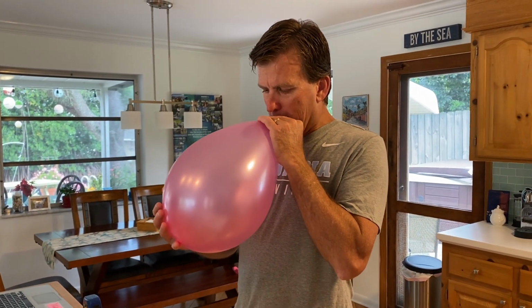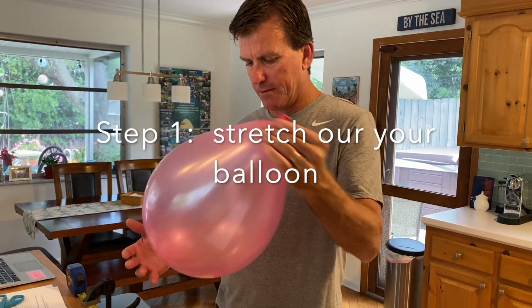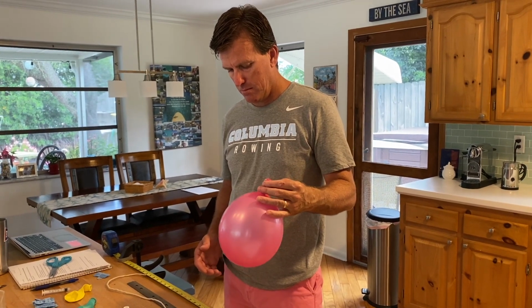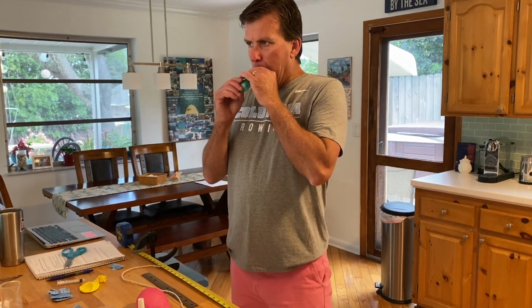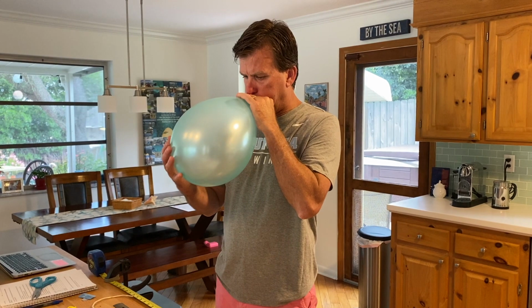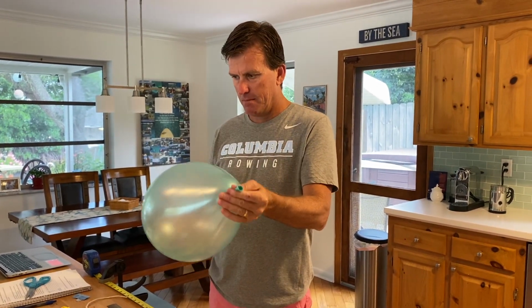Okay, right now I've got Brito with his great lungs blowing up the balloons to stretch them. That's enough. Stretch them out. And he's gonna do that for each of the balloons just to get them stretched out, because we're trying to measure the amount of volume that the CO2 fills the balloon with, but we don't want the CO2 to work so hard that our pressure readings are off. So we're stretching the balloons so that we can just make the assumption that the pressure on the balloon is atmospheric pressure, and then the pressure exerted by the balloon is atmospheric pressure.